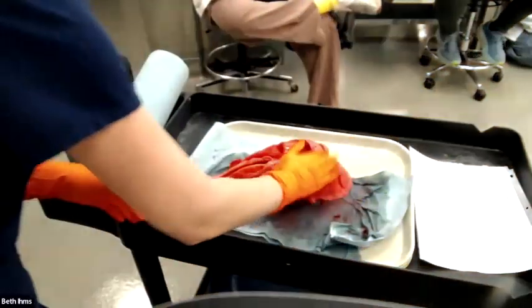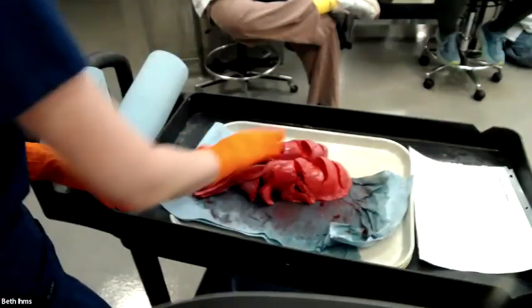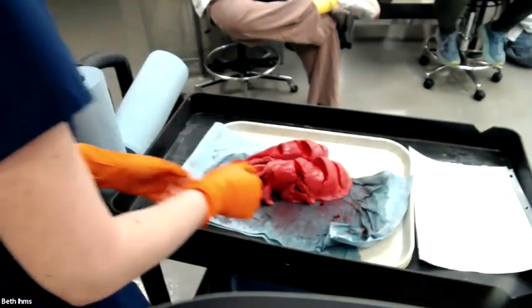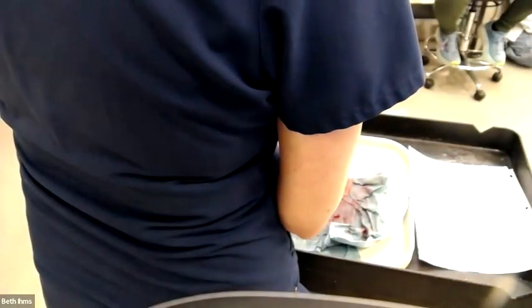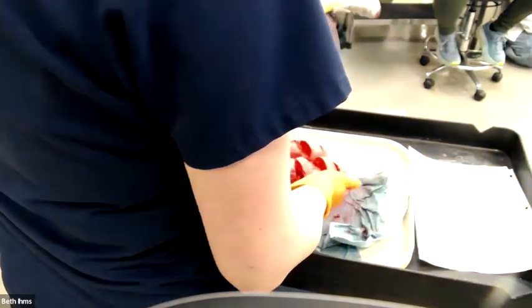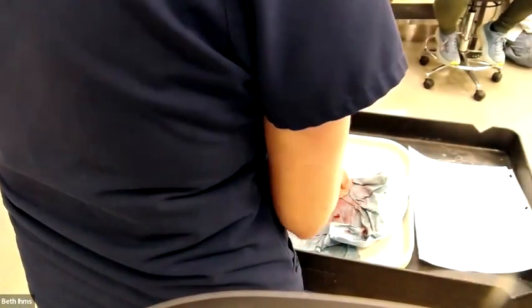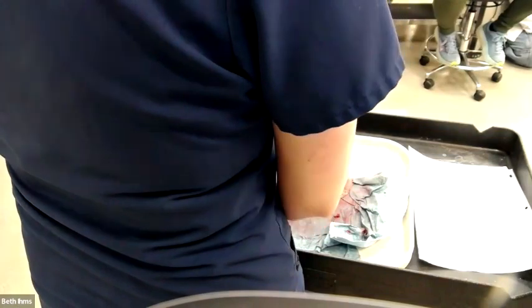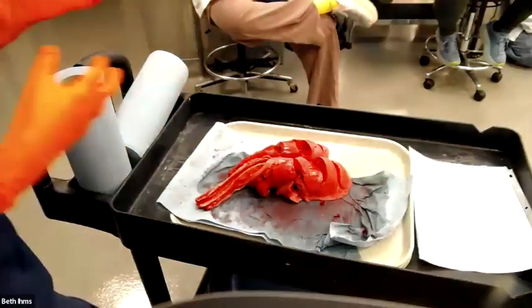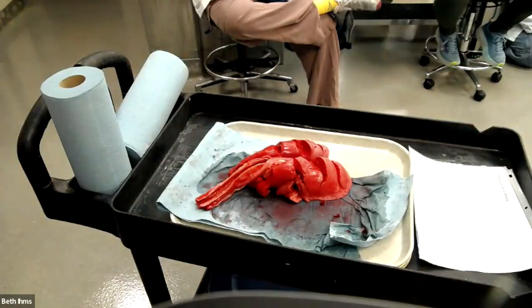And some people probably saw this. It should also have a nice little jiggle to it. Hear that sound? It's kind of a dry sound. A normal healthy lung should be fairly dry. If your lungs are wet or heavy or the surface is shiny, you have pulmonary edema. If you have foam in the trachea, foam is water mixing with air. Air is in here. You add water to the lung, you get foam. So foam in the trachea tells you there's pulmonary edema. So that's kind of how we're using these descriptive things and these findings to make inferences and do detective work on the cause of death.